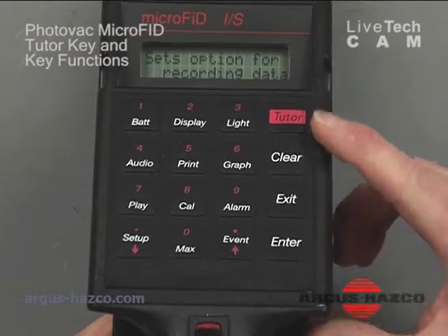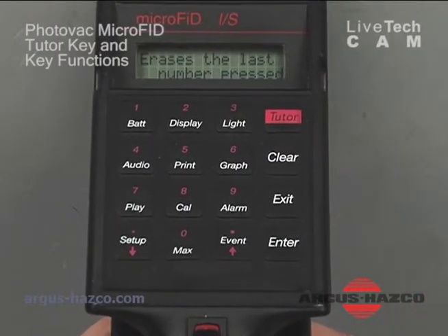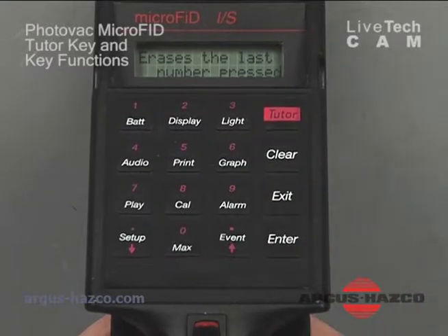A couple keys I did skip here. Clear key will clear any number entered. And then exit will exit any function. And then enter will enter any function. And that's it for the tutor operation.